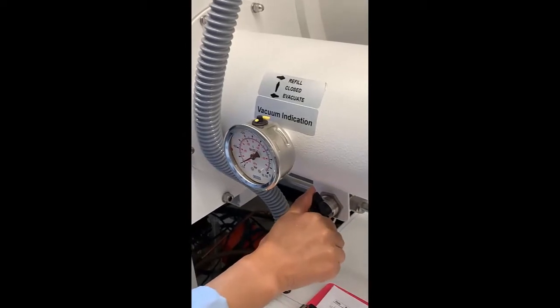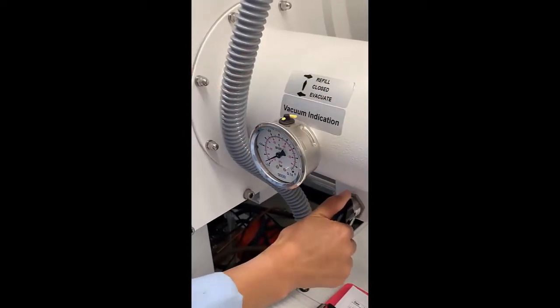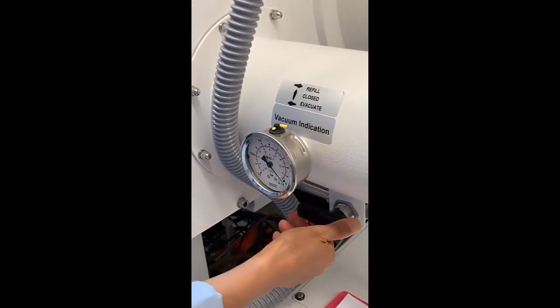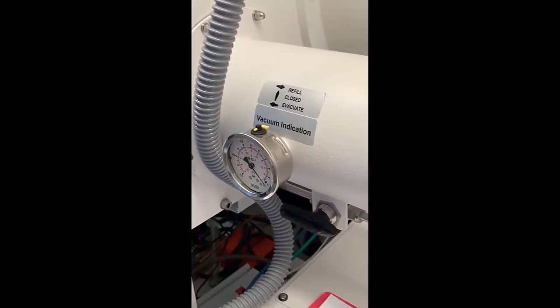After the third evacuation, you refill the chamber one more time, and then return the valve to the closed position.